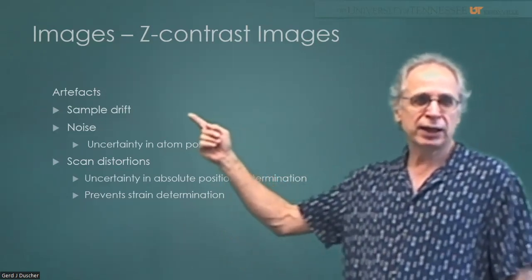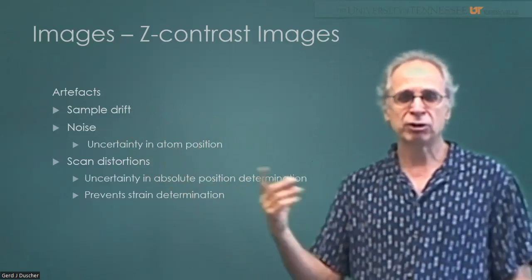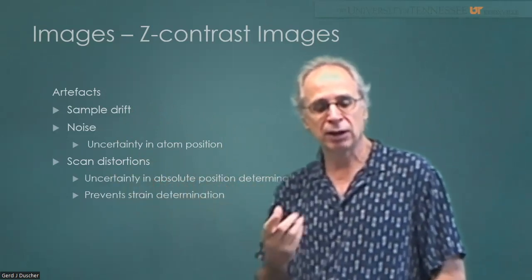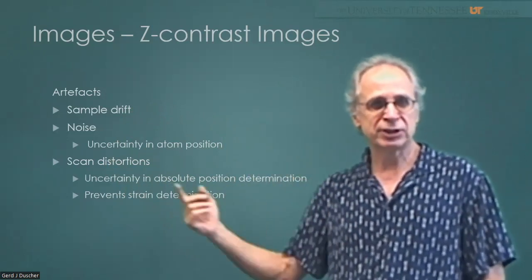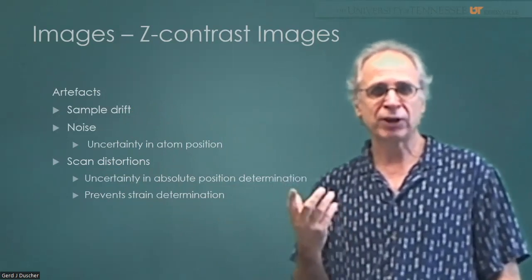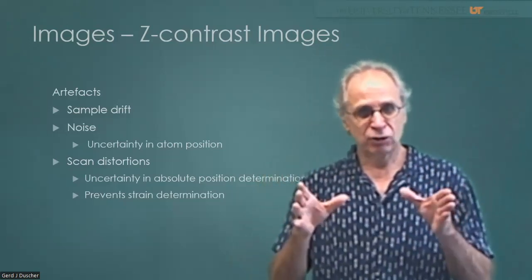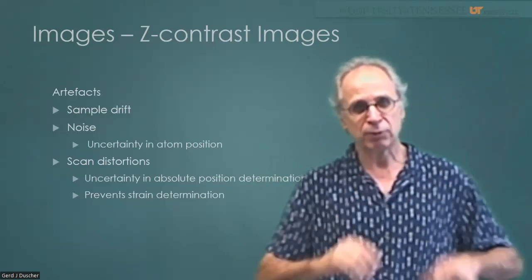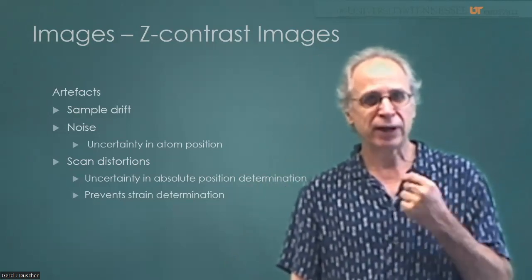Why? You can get rid of sample drift. The noise in a single image can be averaged out. And if you do several scan image stacks, then you can get actually an idea of the scan distortions that are non-random and that you can then subtract. So that's what we're going to do today. We are going to take image stacks and try to get the atomic positions as accurately as possible, and we want to determine the strain of an image. And the question is, how accurate can we do it?